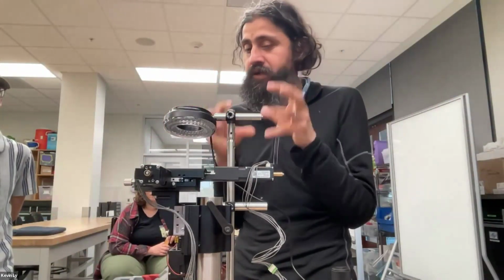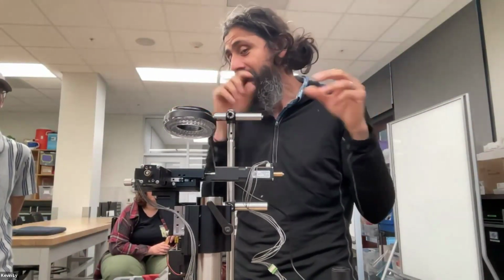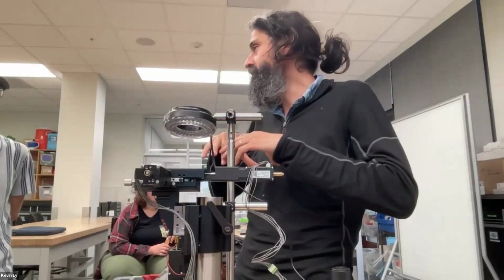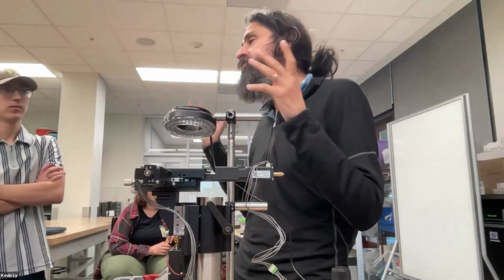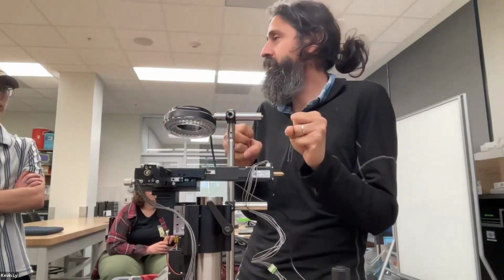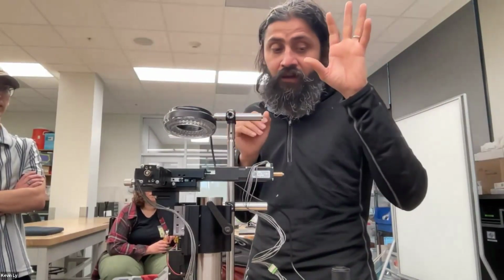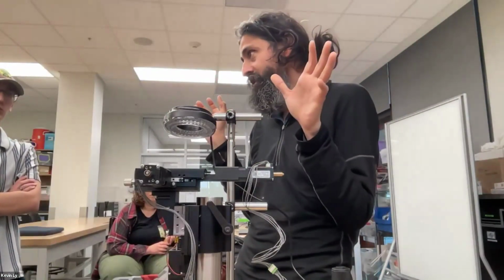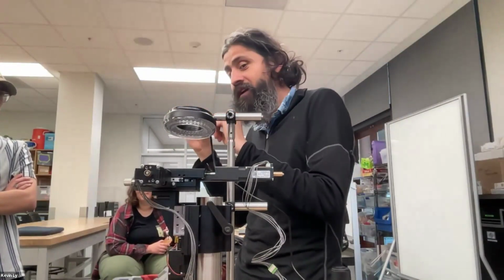But the core vision of SQUID, now it's expanded to 30, 37 different microscopes. We have commercialized this platform. So if you go to cephla.com, you find all kinds. We make confocals, we make optical pooled screening, expansion, any high-end microscopy you can imagine. But at the core of it, it's always this. And it's open. The hardest part of all of this was the sets of drivers and a completely open source software stack, which Hannah is going to do a quick demo for. I have to run to start the group meeting.